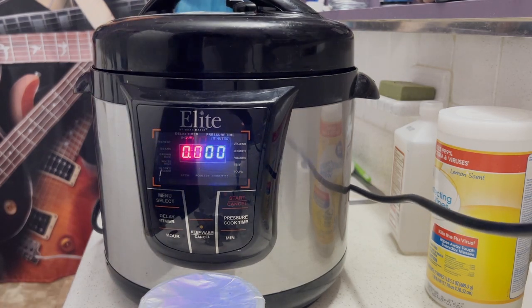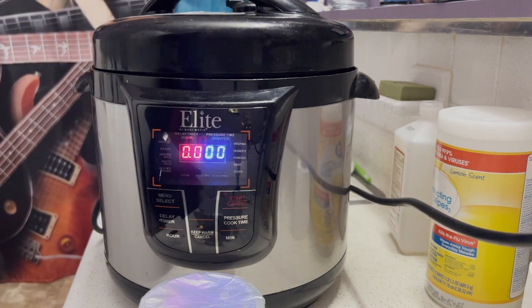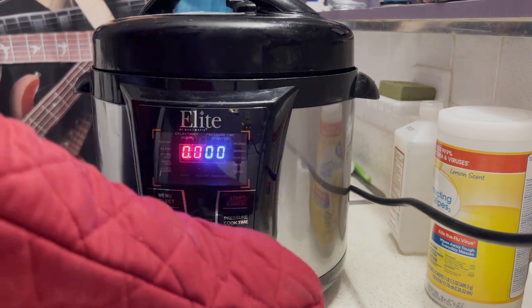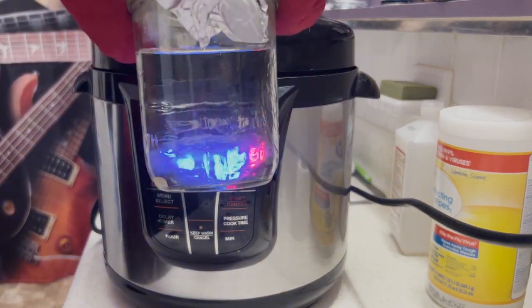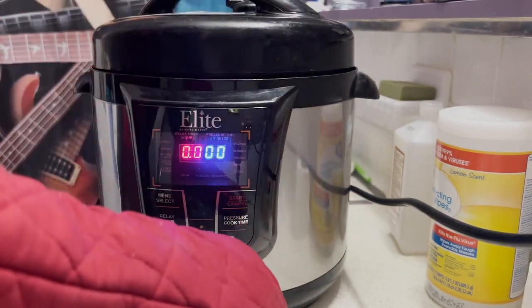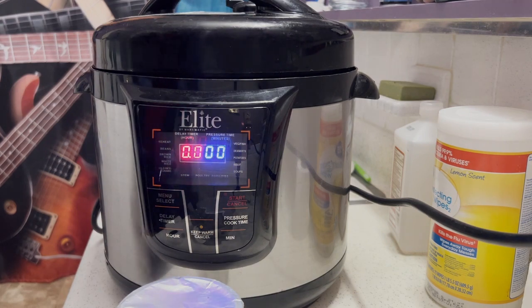Make sure you don't keep the jars inside the pressure cooker for too long after it's done. Otherwise the bottom of the glass may crack and come off very cleanly — it won't explode, but it'll come off almost like a pressurized slice. So just be very careful here.